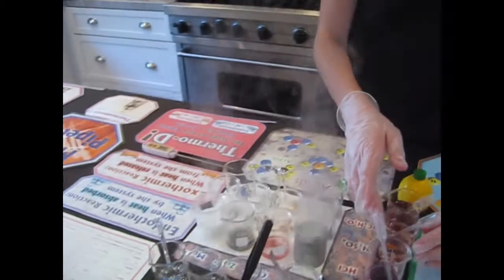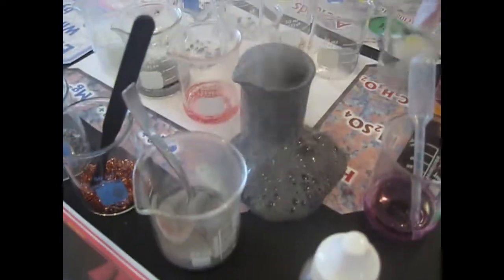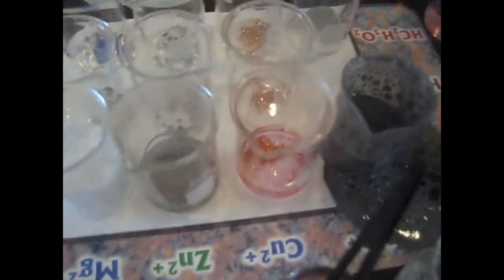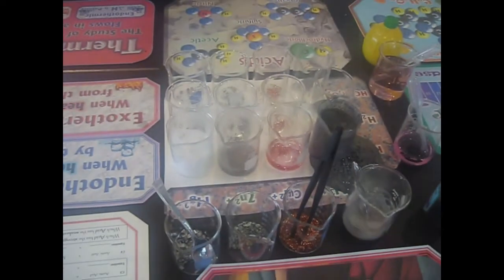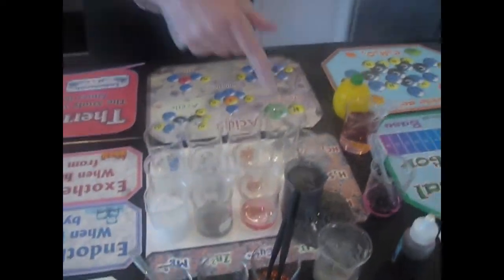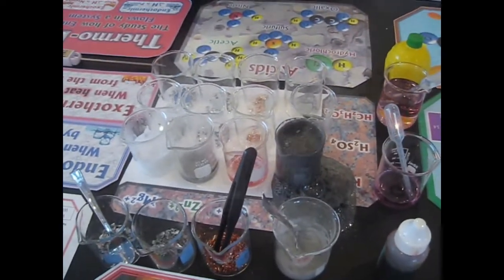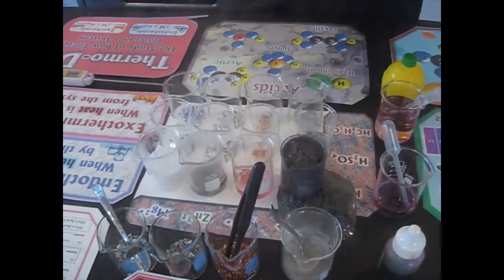Well, that's quite a good one. Wow. Oh man. Whoa. It took a while to start, but then it went kind of overboard. Wow. And then what about this one? Anything happening there? Not yet. Okay. I'll make new placards. That's just for the dramatic effect.